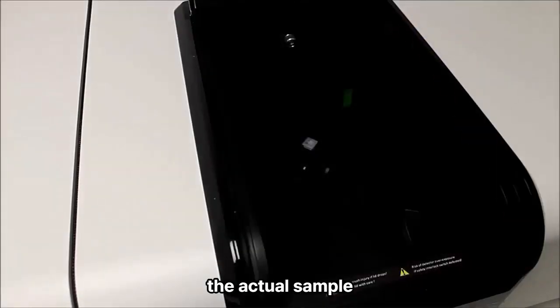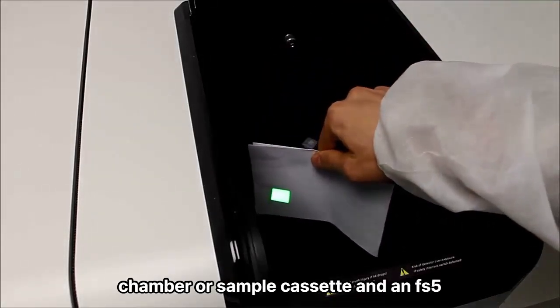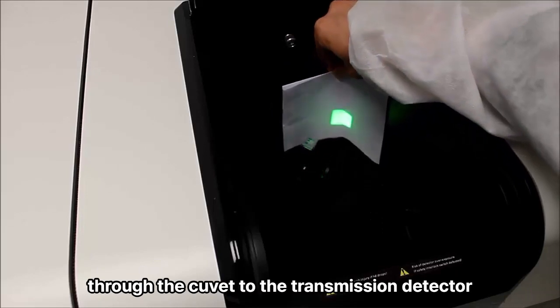This shows you the actual sample chamber or sample cassette in an FS5. You can see the light passing along the excitation path through the cuvette to the transmission detector.